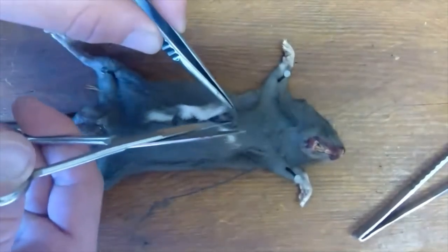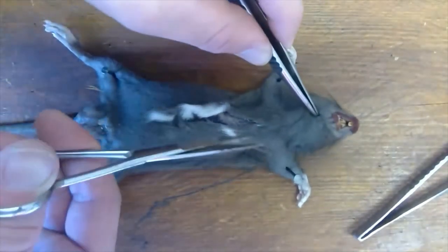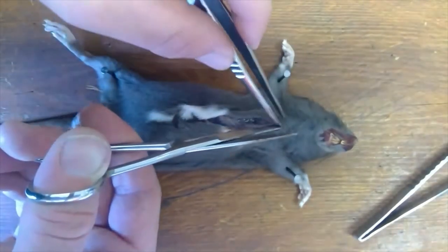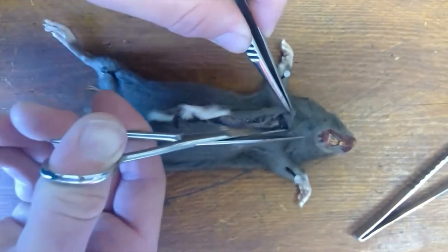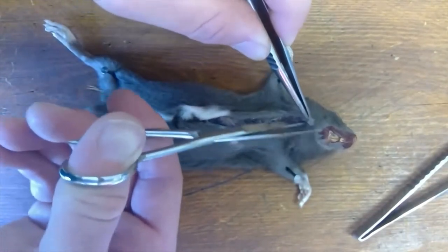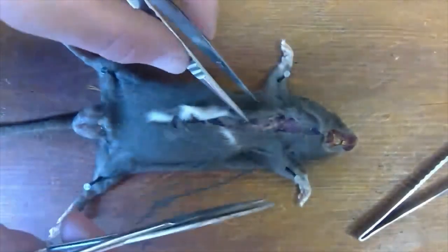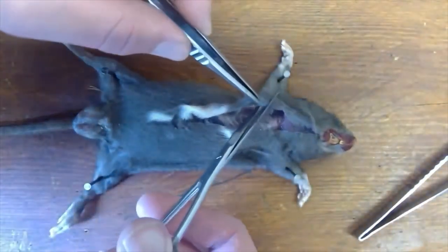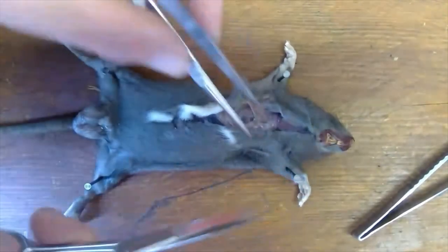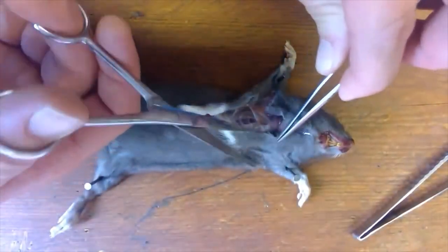I'm going to cut to begin with all the way up to his chin. If you watched the last dissection we had a female — we've got a male this time — you may be able to spot the difference already. We'll go right up there and then cut down into the arms. This just allows us to get the skin out of the way so we can then do the dissection.